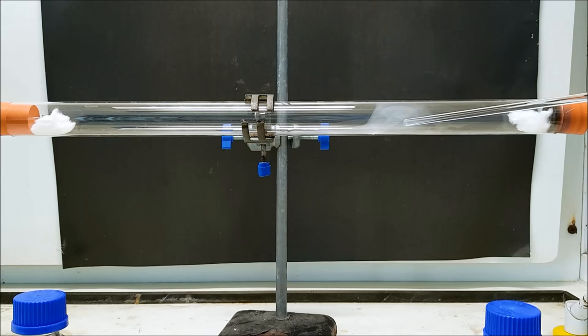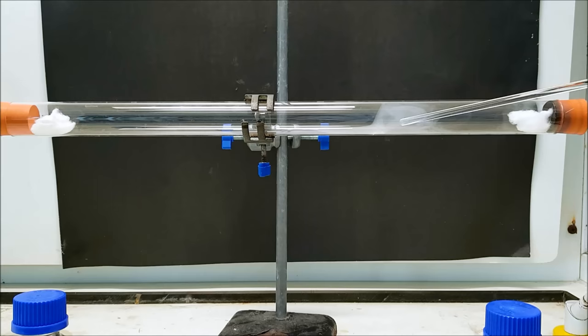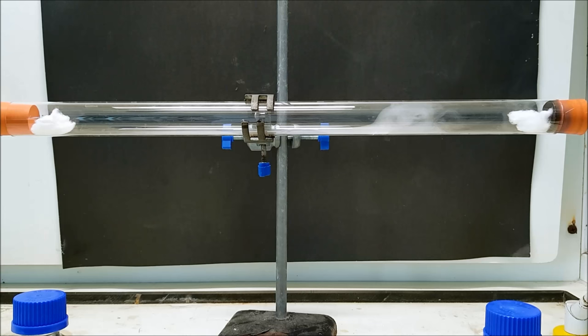Well, hopefully you've started to observe some white cloudy material forming here. It's a solid. It's swirling around as a smoke suspended in the air there.